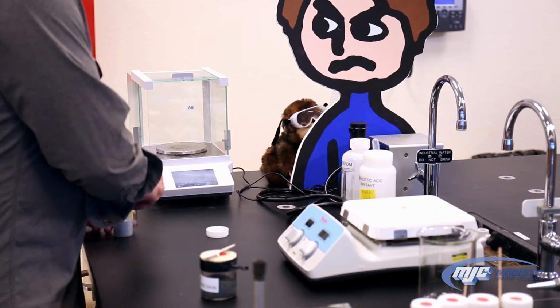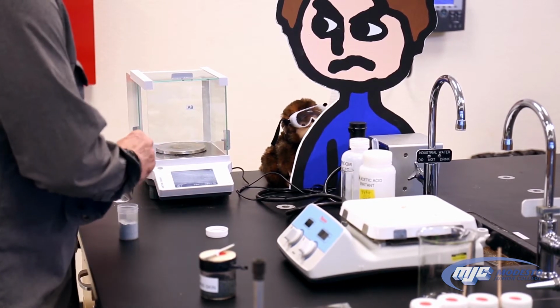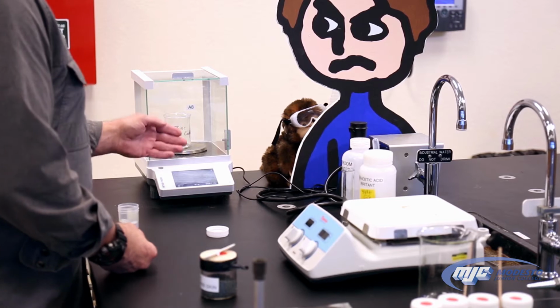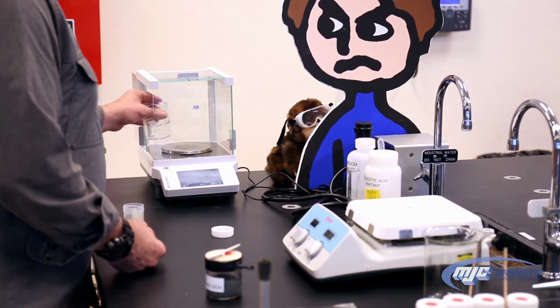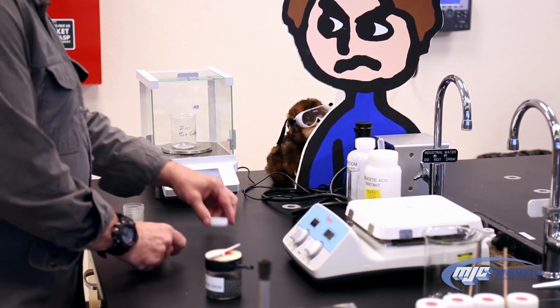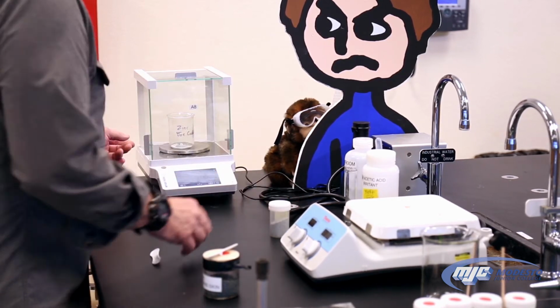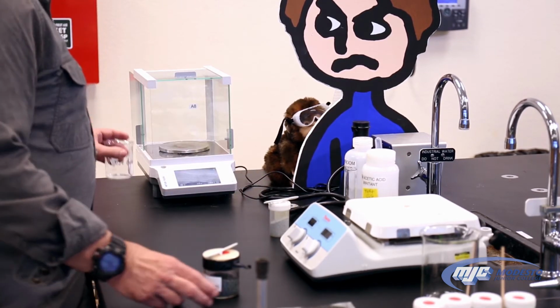Now, remember, zinc's in excess, so if we put a little bit too much, that's not a problem because we're going to weigh how much we have at the end anyway. So there we go. Close the door, record that number, that goes in your data table too. That's the mass of the zinc that we have initially. Then, now that we have that mass, tare the balance. So now the balance says 0 with the beaker and the zinc on there. Take it out.